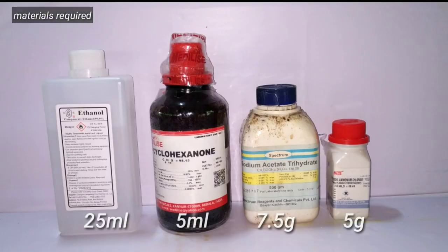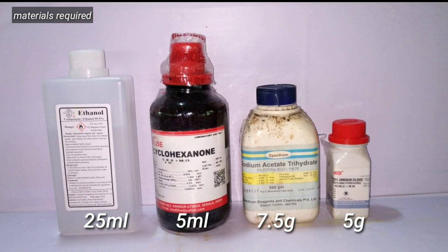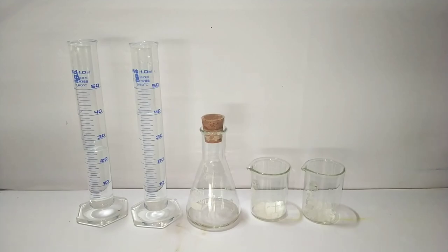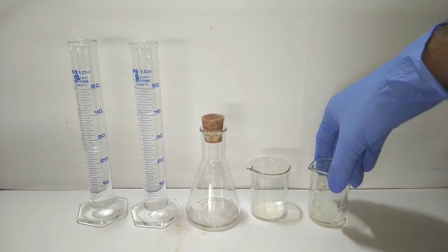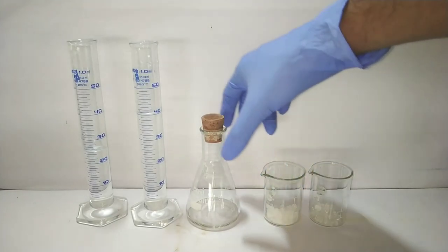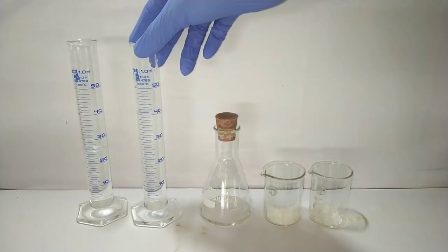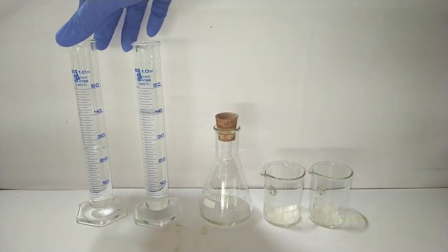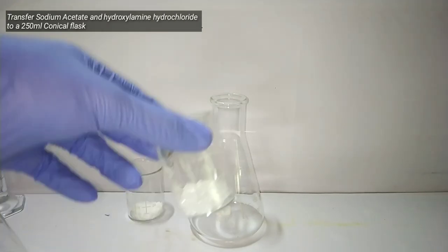The materials required for this preparation include 5 ml cyclohexanone, 7.5 grams of sodium acetate, 5 grams of hydroxylamine hydrochloride, 25 ml of ethanol, and 40 ml of distilled water. Here we have already pre-measured the compounds.